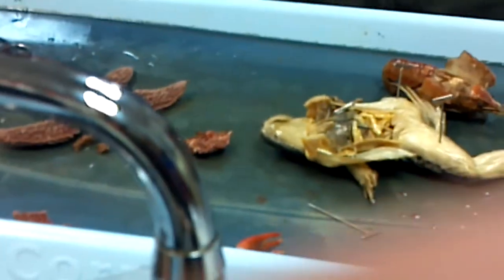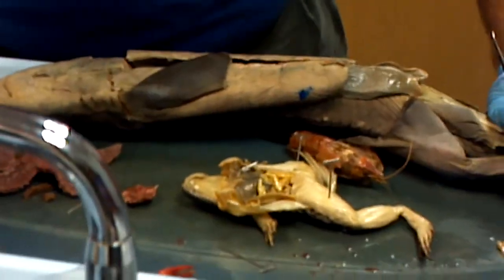I've pointed out as much as I want to point out. I have models of everything. I have dissected specimens of everything except the clam, and I haven't dissected the nematode yet. Besides the intestine, almost nothing inside the nematode is findable because the heads are so small. These are pretty much the live specimens we'll have. There'll also be the clam, and I haven't done the squid yet — I actually better cut the squid. I'm going to set these aside to let you guys look at them while I chop a squid to pieces.